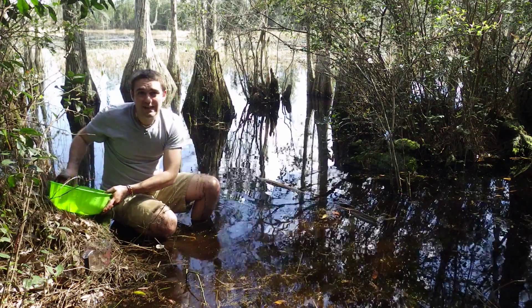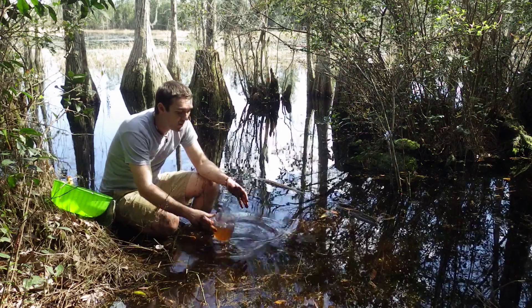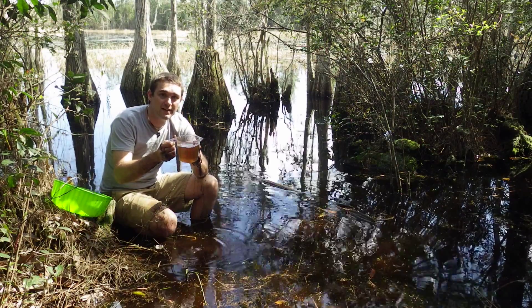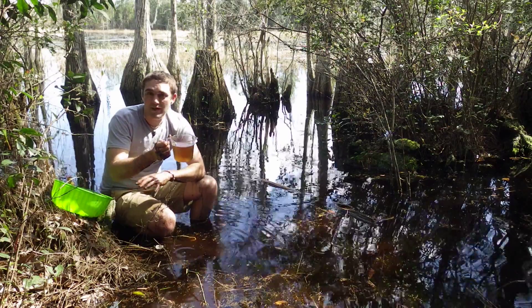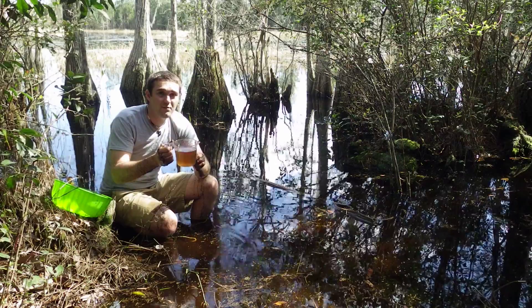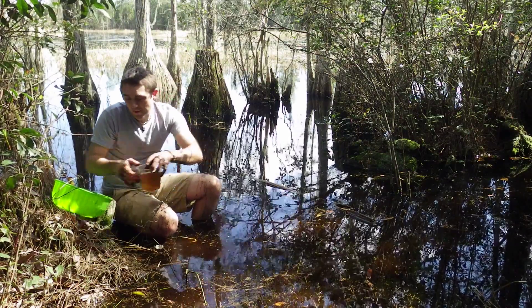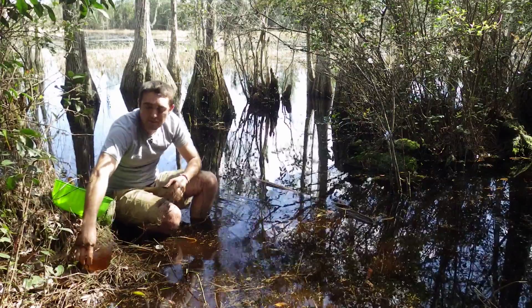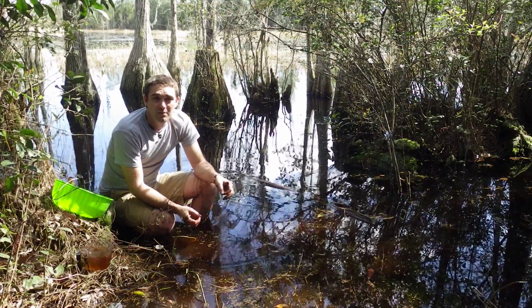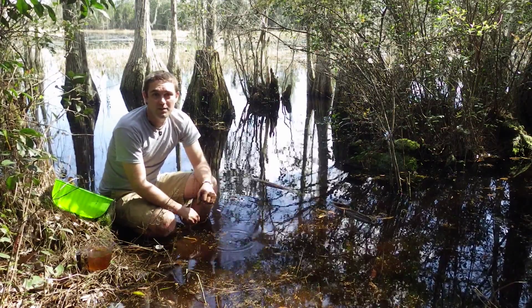The other material I need from this environment is the source water. This source water is equally important as it also has microbes living within it. Adding this to the mud mixture we'll be making up in our lab is what is going to enable us to build the bacterial communities. We're going to take these two ingredients up to our lab, which is on higher ground and out of the swamp, so we can put them together and start growing the bacteria.